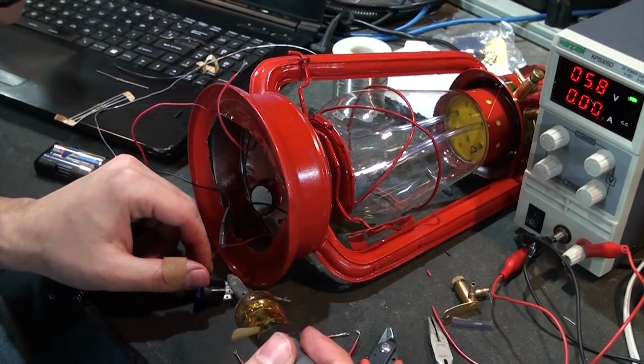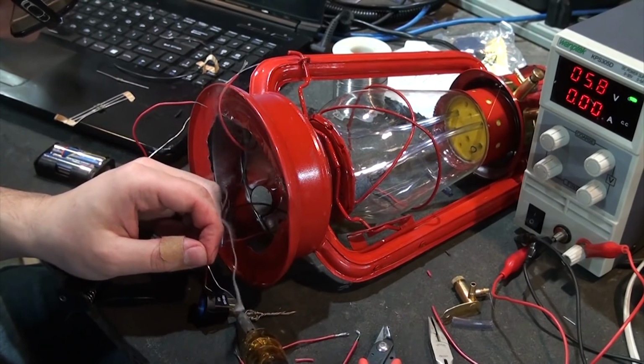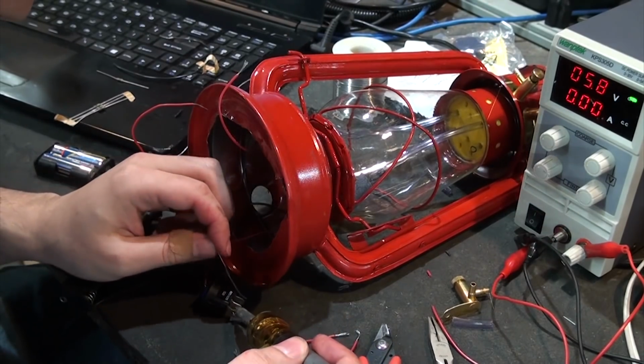Finally, the switches were wired up and a battery pack was added. These batteries won't last nearly long enough to make this really useful, they're just here so that when I want to show this off and move it around, I can. Off camera, I eventually added a wired power supply so that this can run all day long without issue.